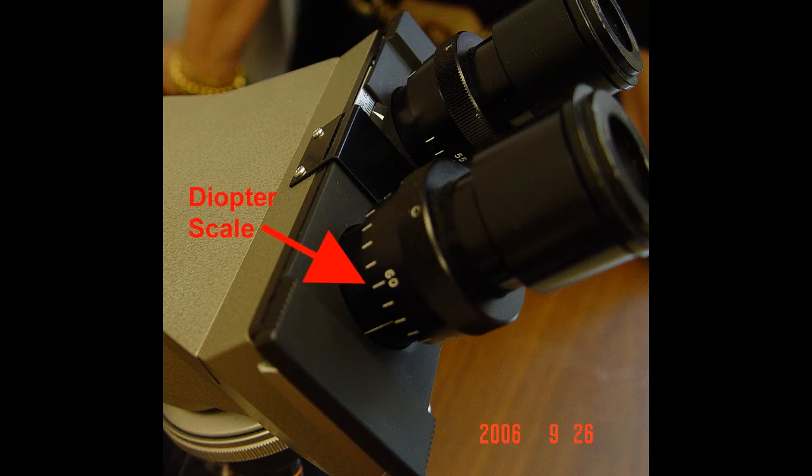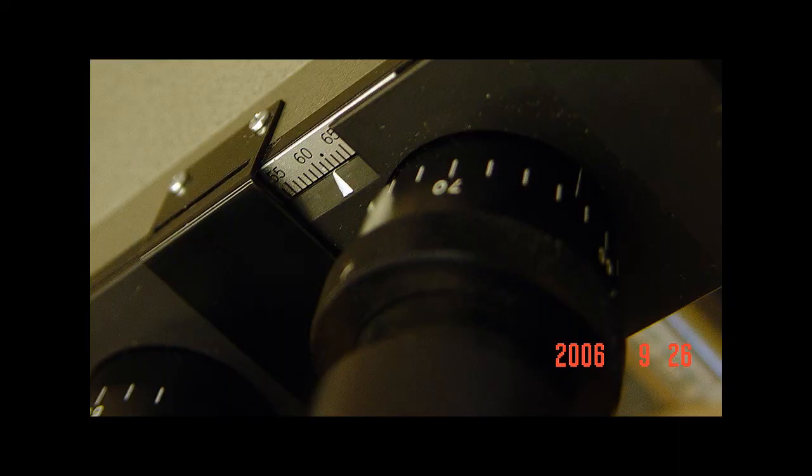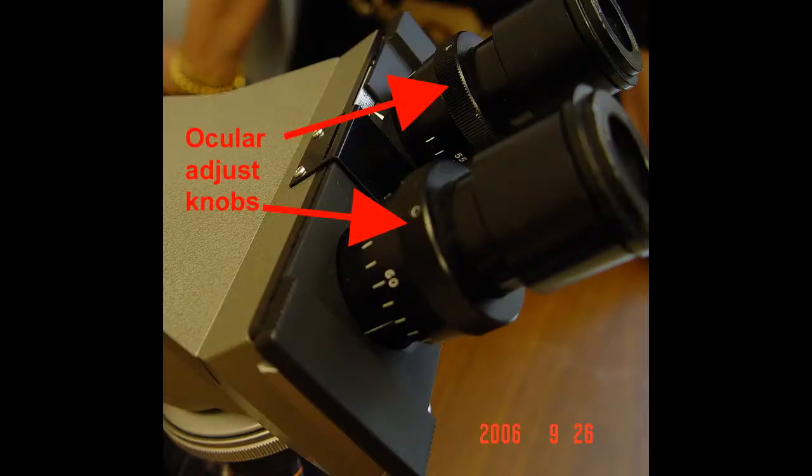The microscopes also allow you the ability to make diopter adjustments. So if you see with different strengths from either eye, you can compensate for that. It's a little bit complicated to make this adjustment, but let me try to walk you through it. Let's assume you've adjusted the interpupillary distance on your microscope so that you're seeing one image. You'll note the scale number for your interpupillary distance. For me, it's about 62. On each of the ocular lenses, there are scales. What I do is set one of those ocular lenses to my interpupillary distance.